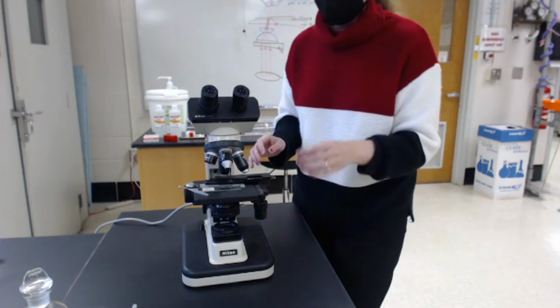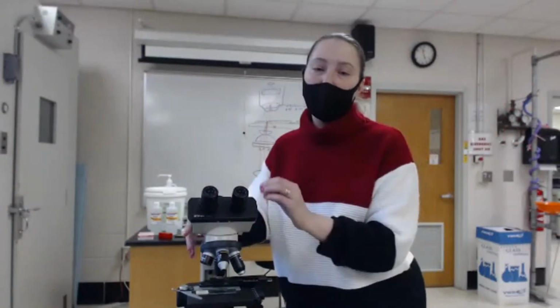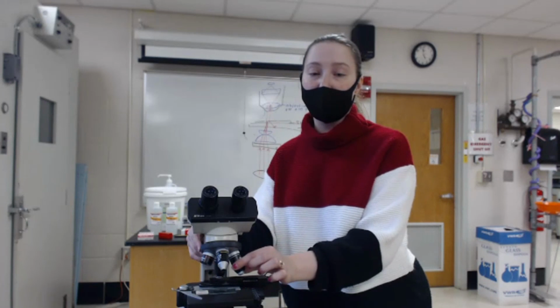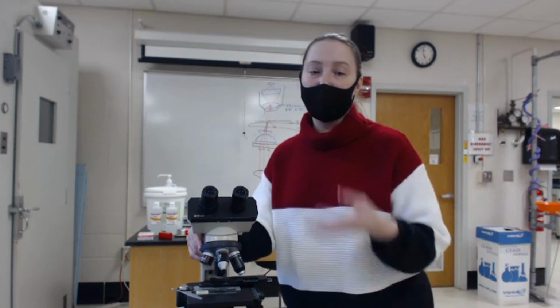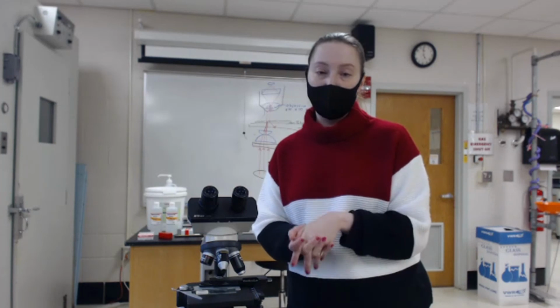When we're working with oil immersion, the most important thing that I'd like you guys to be aware of is that only the oil immersion lens should ever come in contact with the oil. The reason is that it's sealed. The other lenses are not sealed. And so the oil can get into the pipe, and then as a result it can get directly onto the lens itself, and it will gum up the lenses. To fix it, we would have to send it to be cleaned or get it replaced completely. It would actually be cheaper to get a brand new one than to get it cleaned. So be sure to be mindful every time you're working in lab: if you're using oil, use it only on the oil immersion lens.